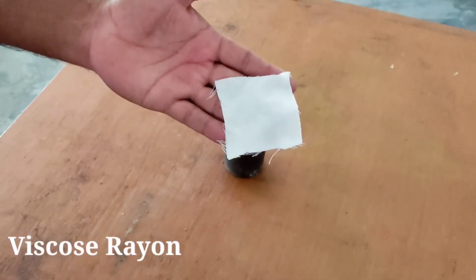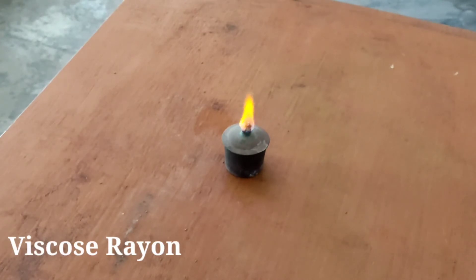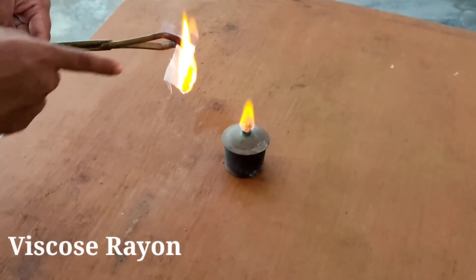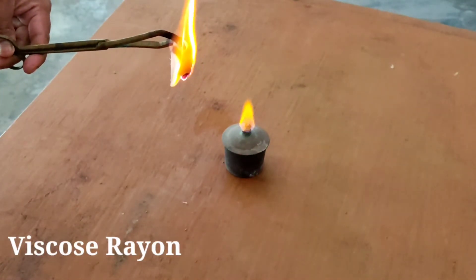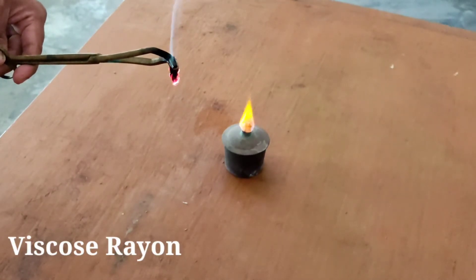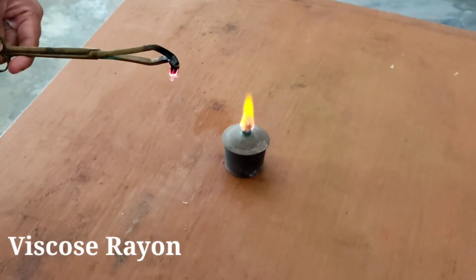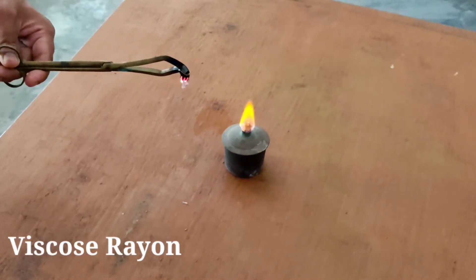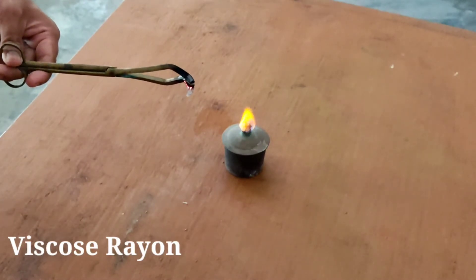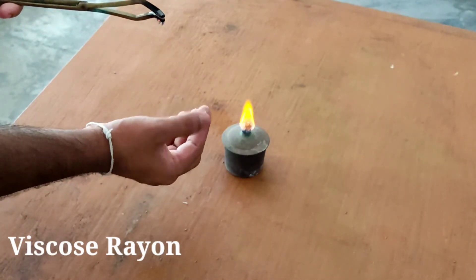The residue of cotton fiber is a fine gray ash color and can be easily crushed. Next, viscose rayon: just like cotton fiber, it burns continuously. It also smells like paper or wood burning, and the residue is fine gray ash that can be easily crushed.